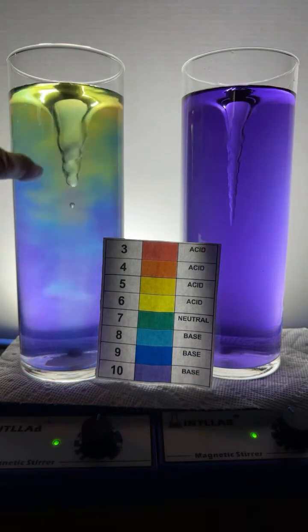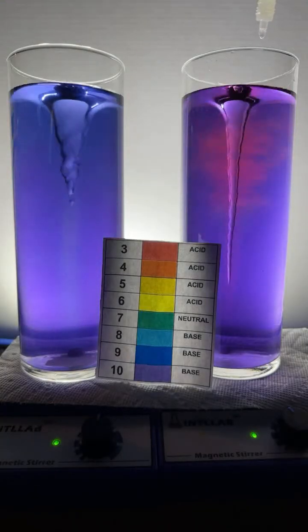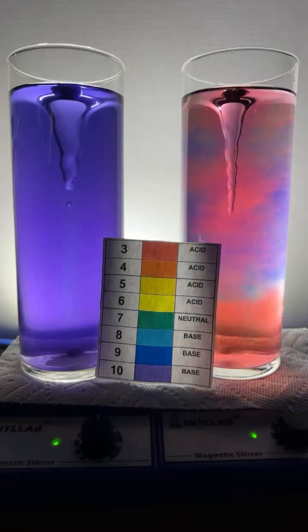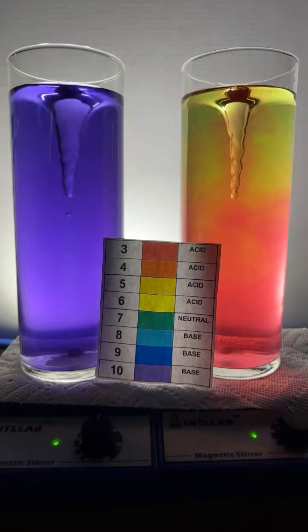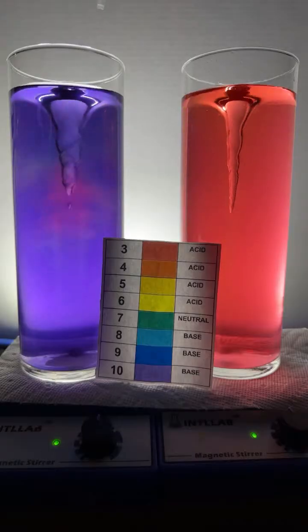Look at it, we got a little rainbow, baby. Come on now. That's what I'm loving. I'm adding acid to the flask on the right now. A little flash of the rainbow. How you doing there, Mist? We're going to add a little acid over here on the left. There's 1 drop. There's 2 drops.